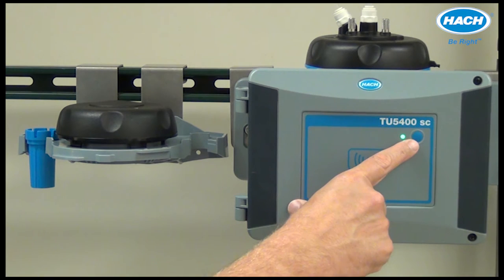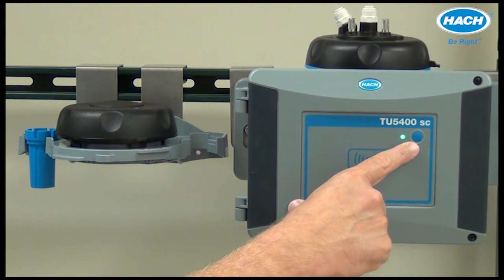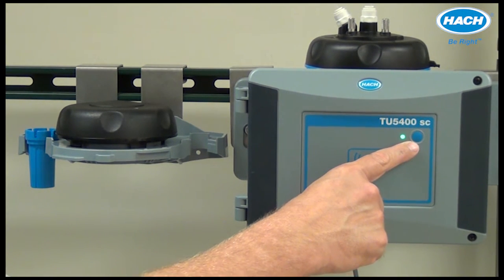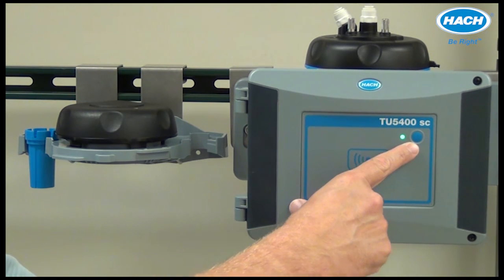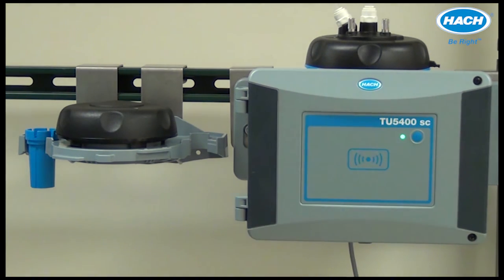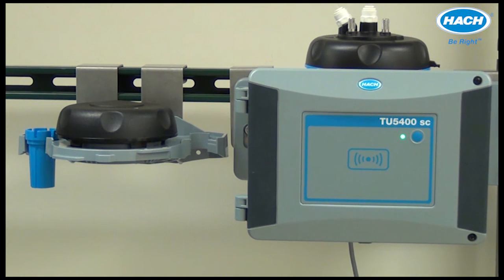The blue button on the front of the instrument can be configured to perform different functions, as shown later in this video. For example, the button can hold the outputs for maintenance or service activities.